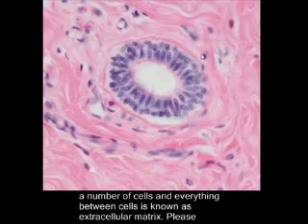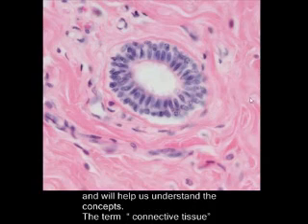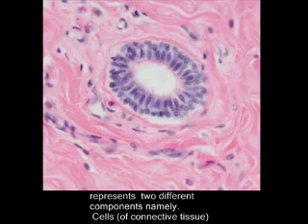We have a number of cells, and everything between cells is known as extracellular matrix. Please note that the tissue does not belong to respiratory system. It just shows better details and will help us understand the concepts. The term connective tissue represents 2 different components, namely cells. These are the nuclei of cells within the connective tissue, and the extracellular matrix.